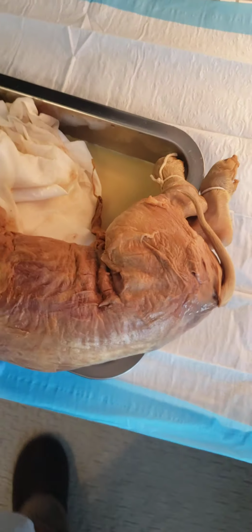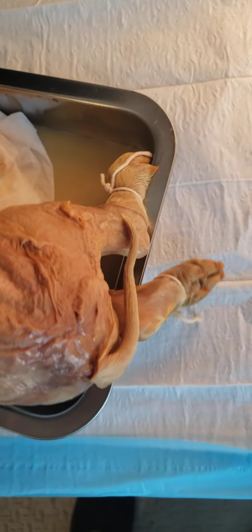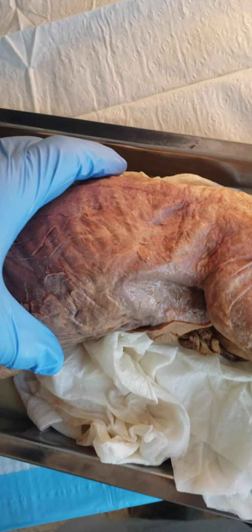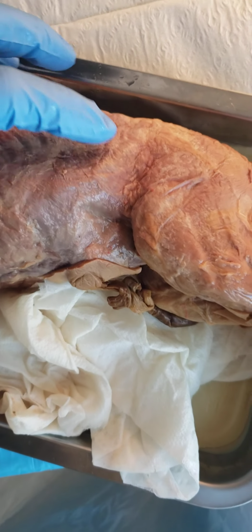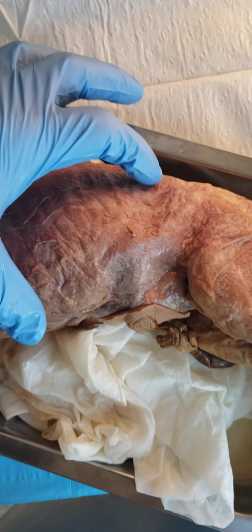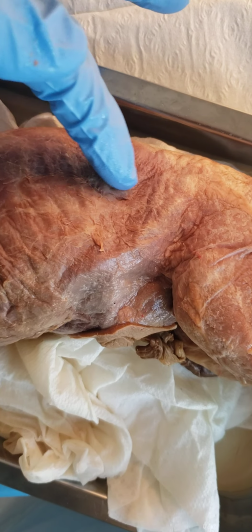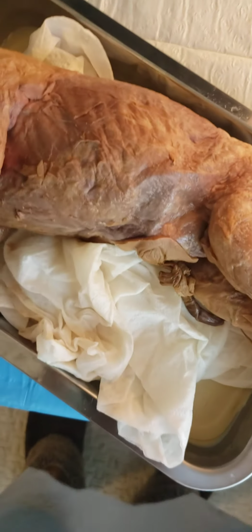The transverse abdominis. Let's get a good picture. Made a few incisions right there that when I was skinning, I was trying not to. Your transverse abdominis is almost like your side ab muscles. If you can kind of imagine right in here is where the transverse abdominis is going to be, right here. Transverse abdominis, and rectus abdominis will be our last one.